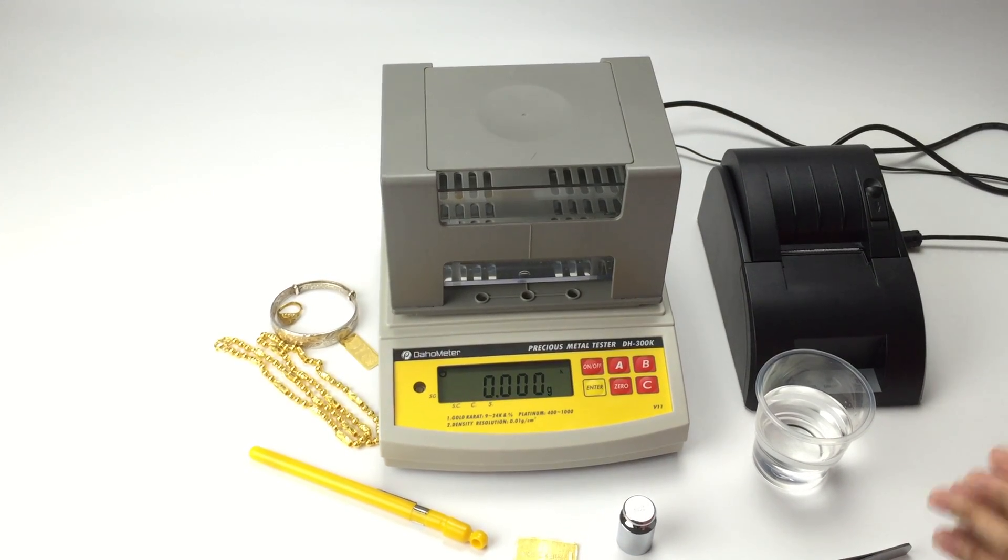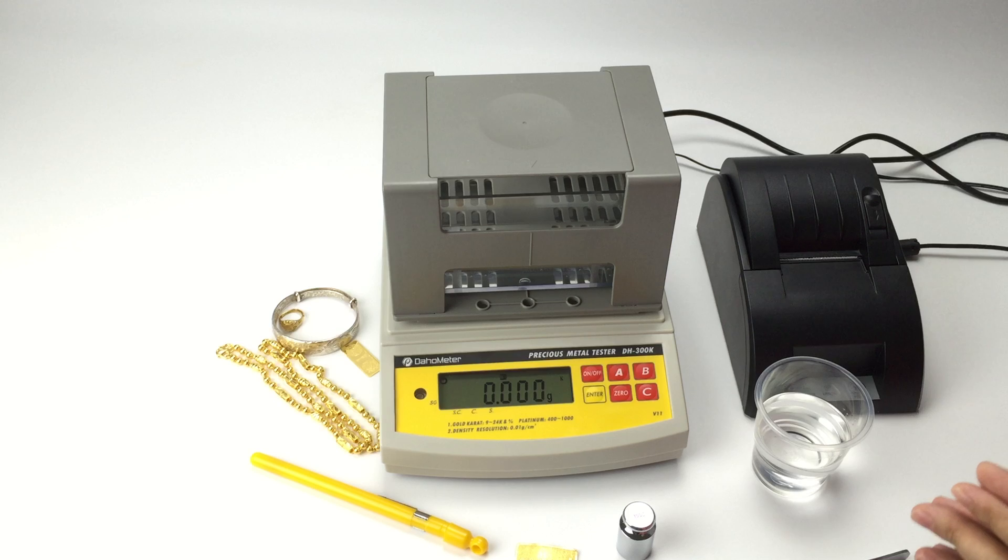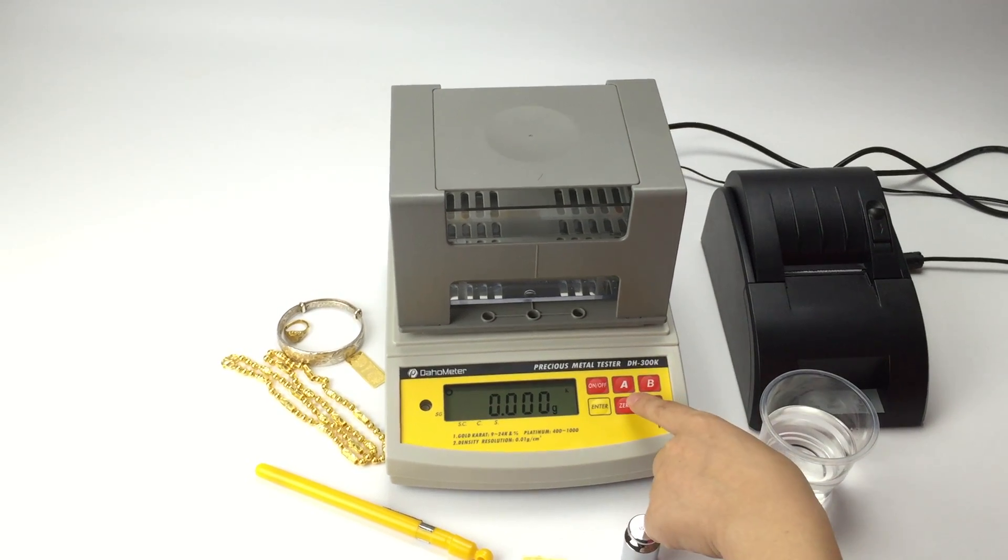First step is to weight calibration. Long press 0.